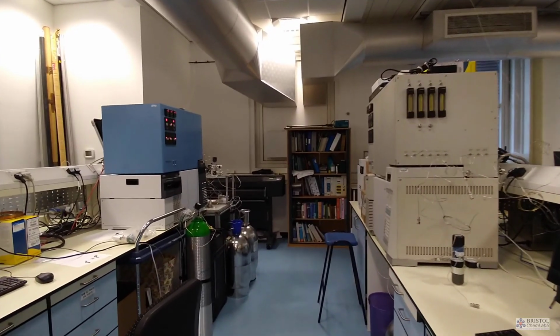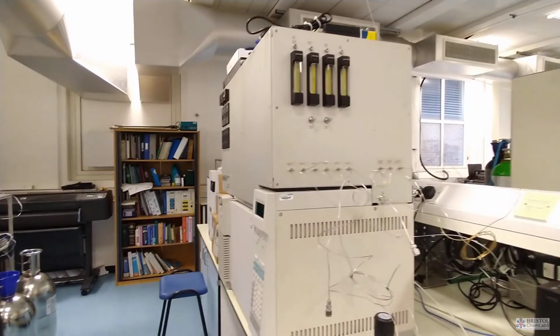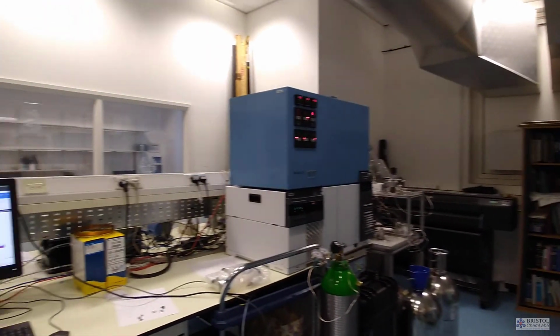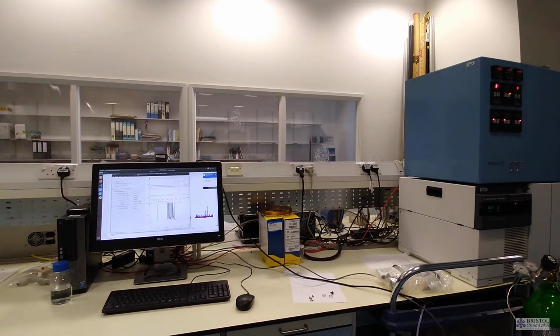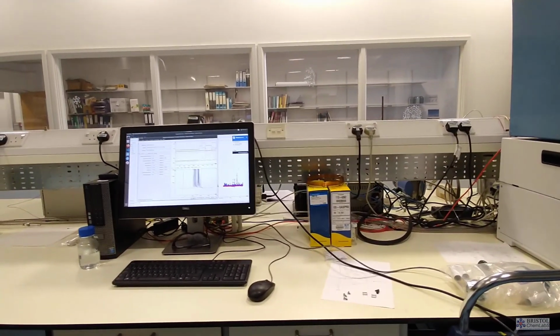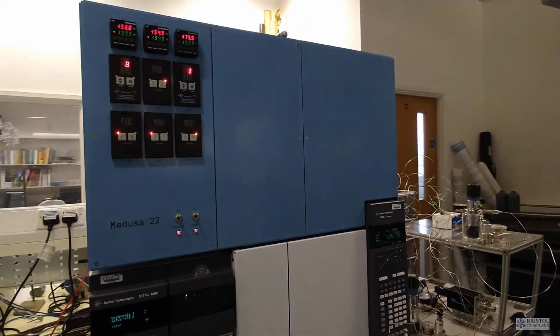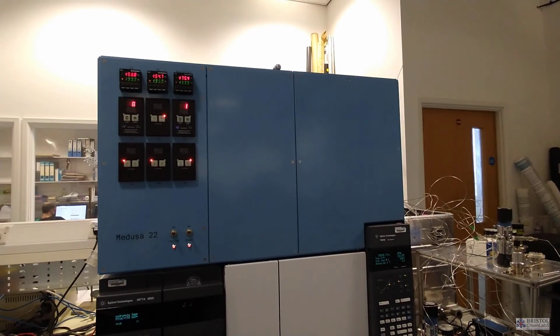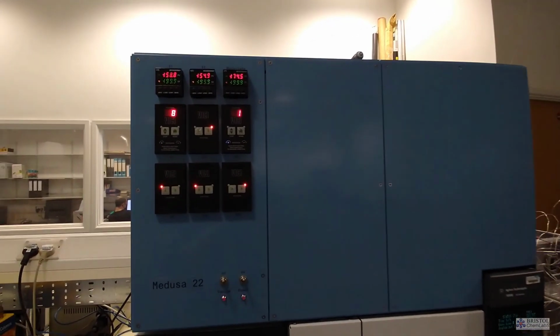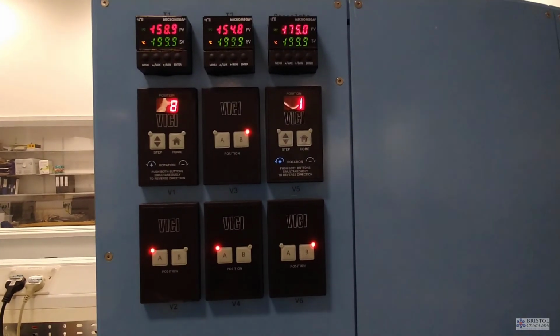For the other instruments, we buy some parts, but we have to build the rest of them ourselves. And that usually makes them much more expensive. For example, these instruments here, there are only about 30 of them in the whole world, and we have 5 of them. To make one of those, it will cost you about £300,000.